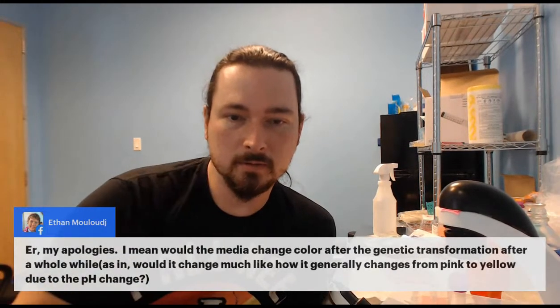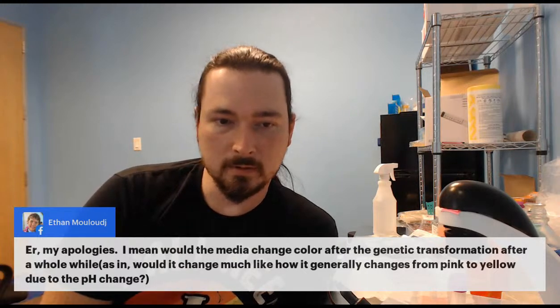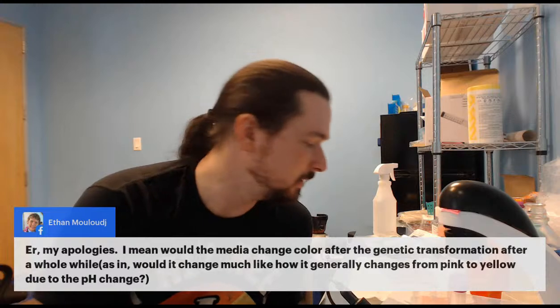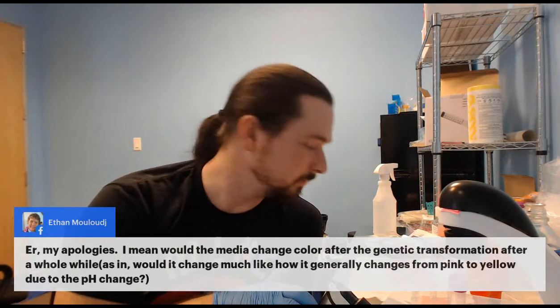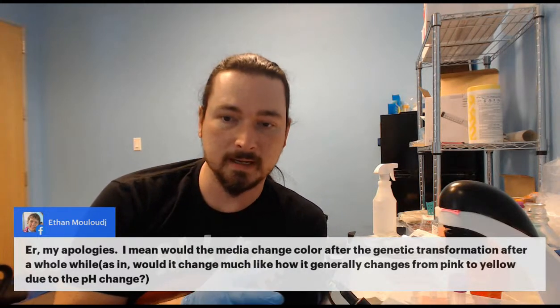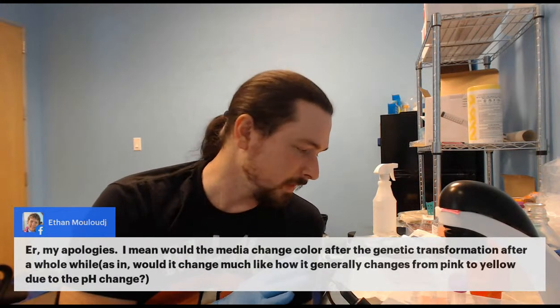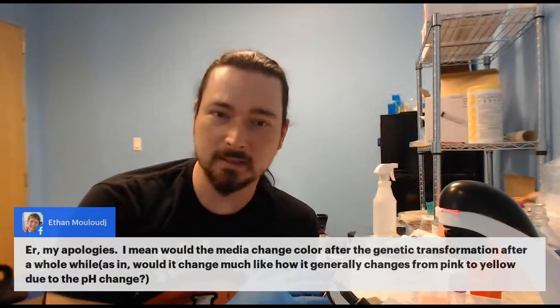Okay, so does the media change color after the genetic transformation? After a while, would it change much, like how it generally changes with pH? I don't know. If you just let it sit there, after it turns blue, the pinkness and yellowness is a pH sensitive dye. But honestly, the blue from the X-gal seems to be an even stronger dye. We're using a ton of it. So I don't know if it would ever turn green, like if the pH got low enough.